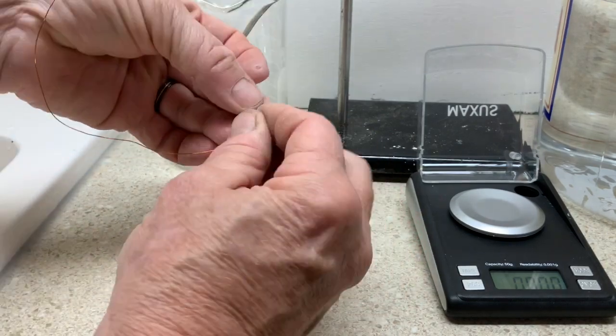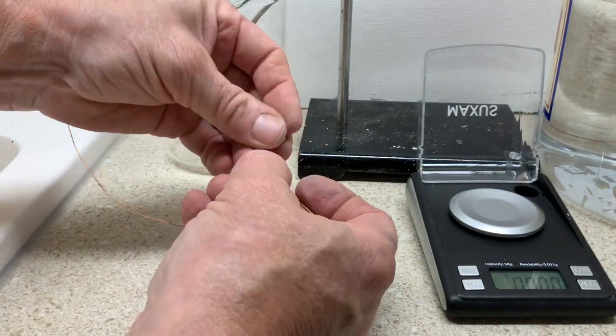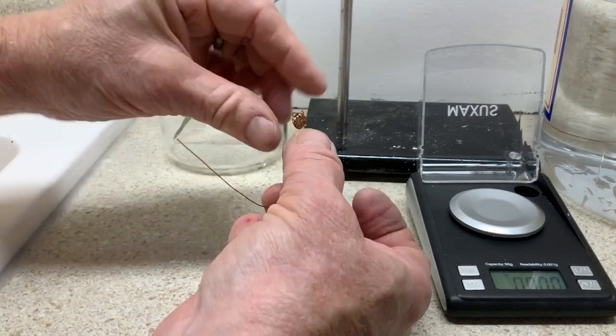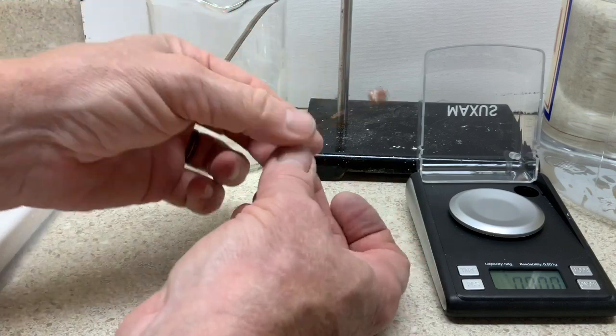Okay, it can be a little tedious, a little bit like making a yarn ball. You can see that I've got the wire completely surrounding but in an open format.